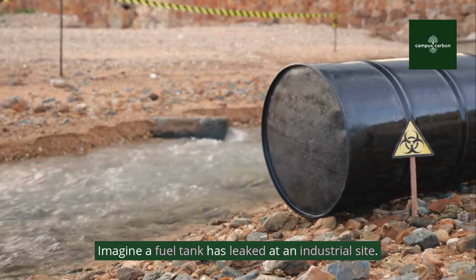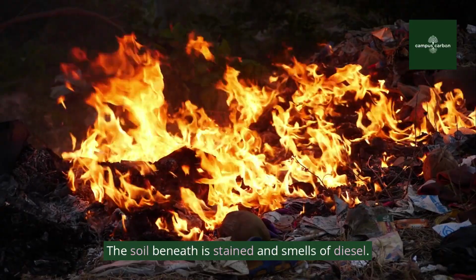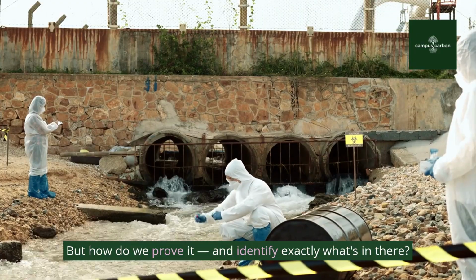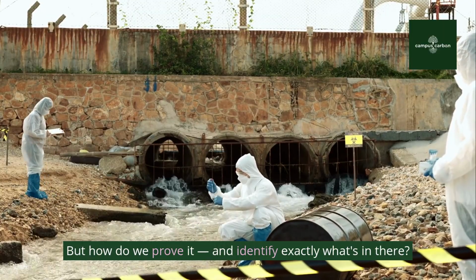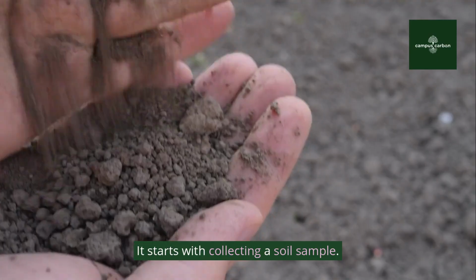Imagine a fuel tank has leaked at an industrial site. The soil beneath is stained and smells of diesel. But how do we prove it and identify exactly what's in there? It starts with collecting a soil sample.